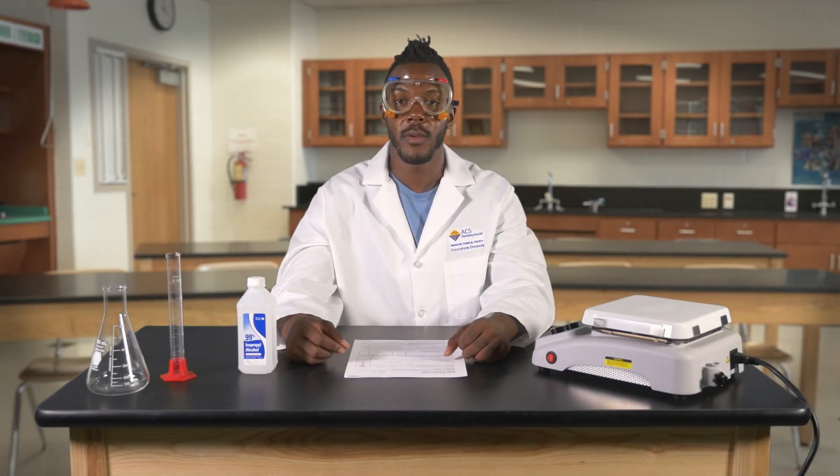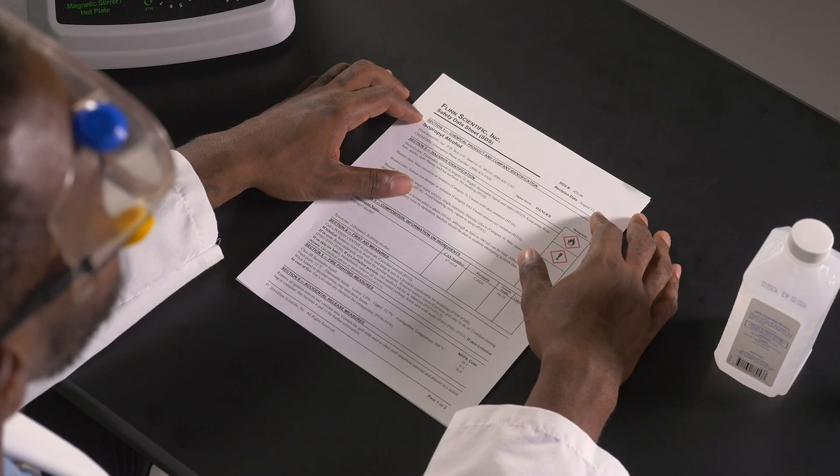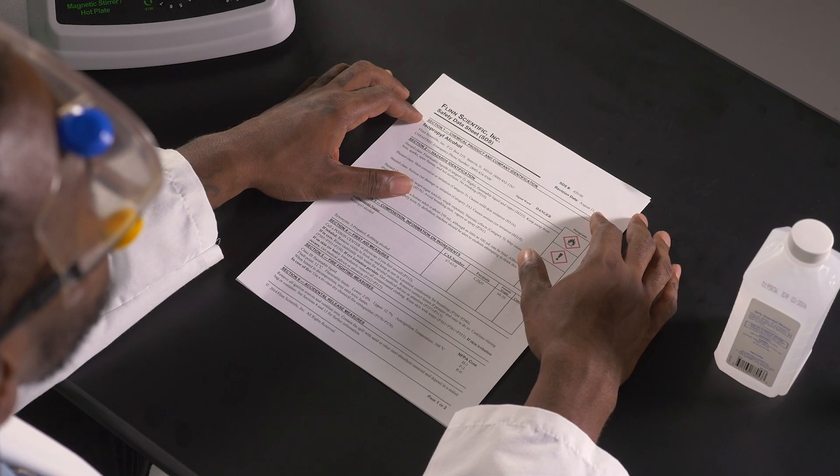Preparation and planning are key to working in the lab. Being prepared means understanding the hazards of any chemicals you'll be working with. The place to find that information is the Safety Data Sheet, or SDS. The SDS provides detailed information about the properties of a chemical, its hazards, and how to protect yourself from those hazards.